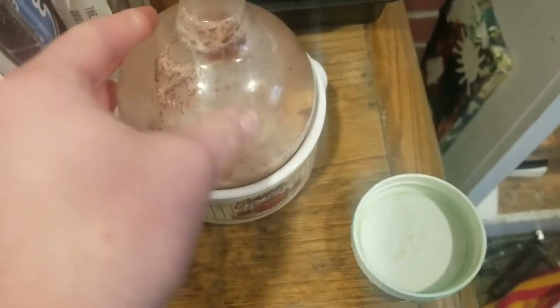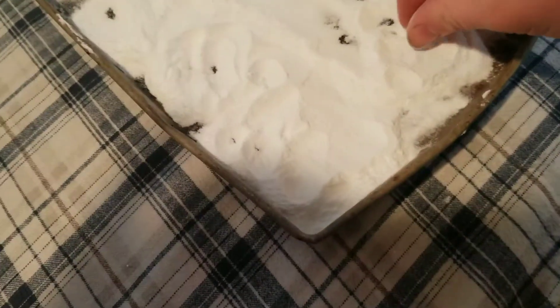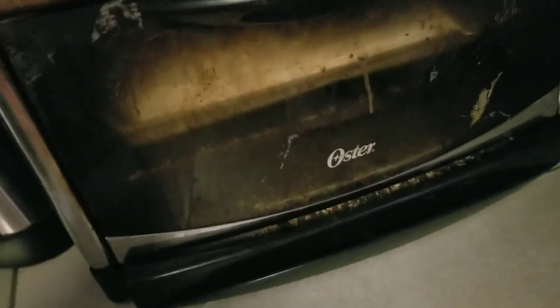If you have a balloon, you can put it over the top to catch and recondense all of the vinegar fumes, which makes the solution a little bit more concentrated. If you want to make washing soda, put baking soda on a toaster-oven-safe sheet and dry it — this converts it into carbon dioxide, water, and washing soda. About 10 to 20 minutes is a safe bet for how long to heat it.